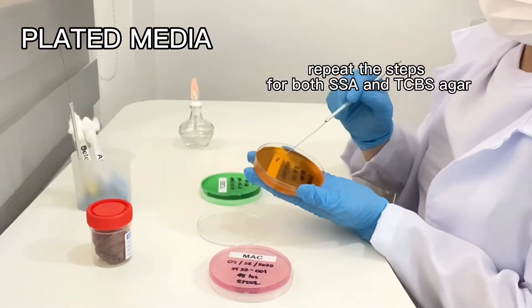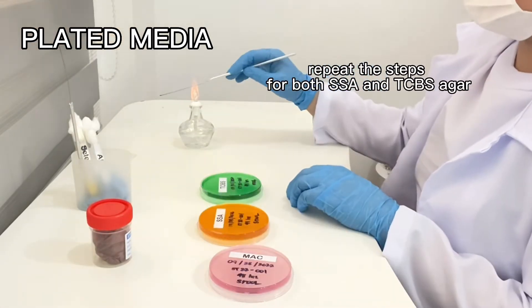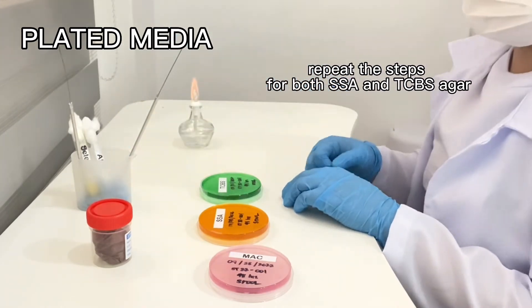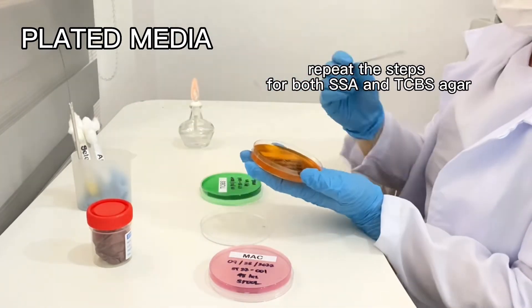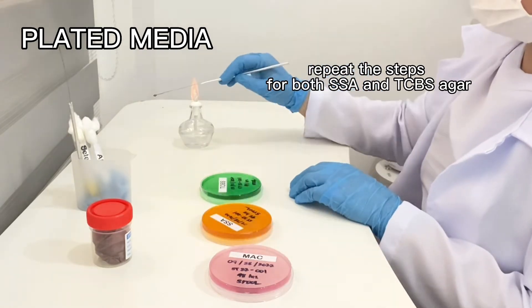Then repeat the same steps for both SSA or Salmonella Shigella agar and the TCBS or Thiosulfate Citrate Bile Salt Sucrose Agar.